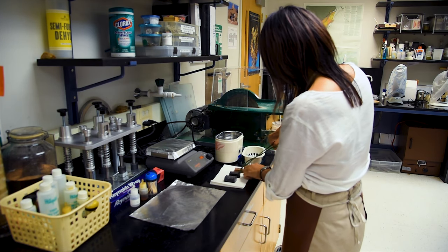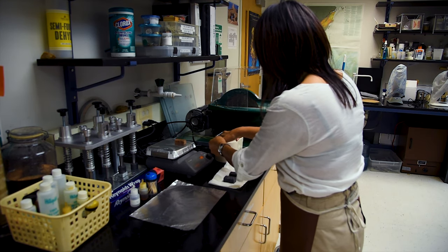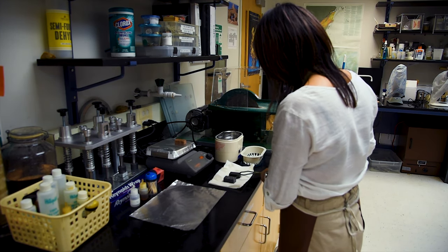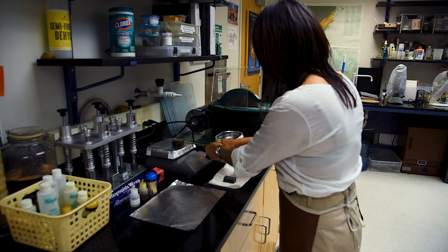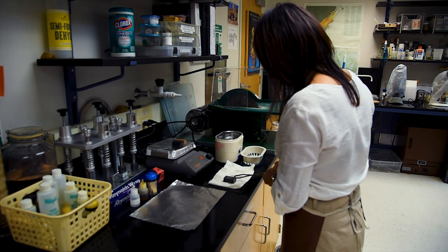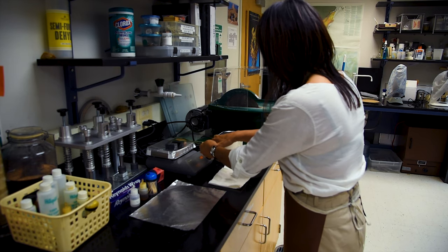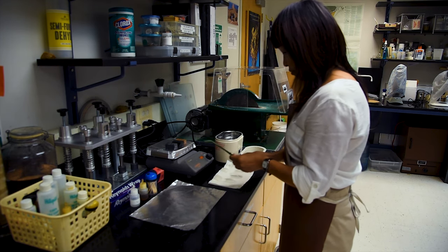Once the chips have been removed and dried off, they may be placed polished side up onto the hot plate. Heating the chip up will allow the epoxy, when it is applied, to flow more easily over the polished surface, soak into any pores or microfractures, and cure faster after it has been attached to a slide.